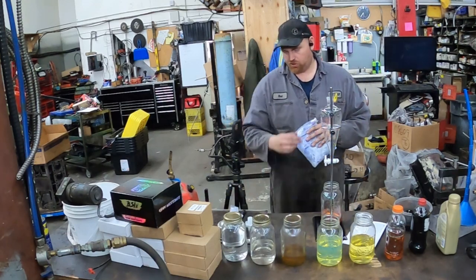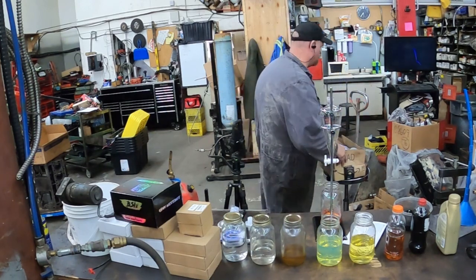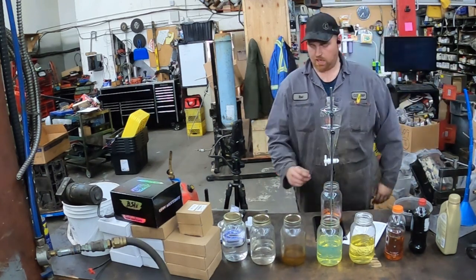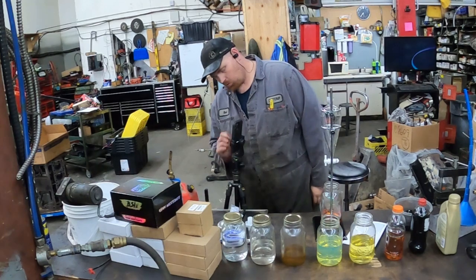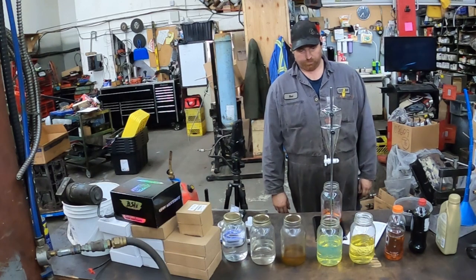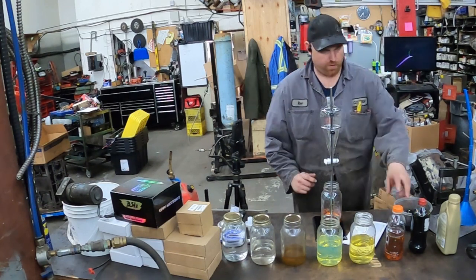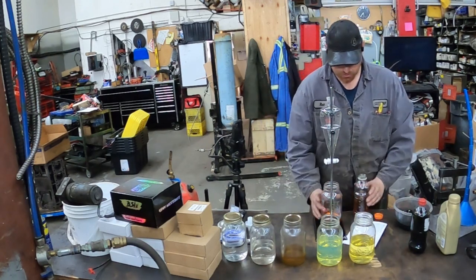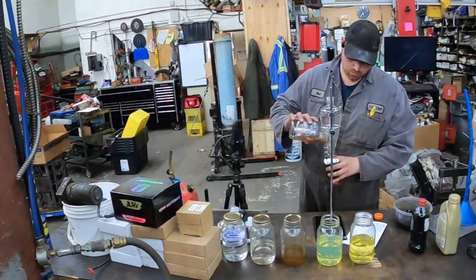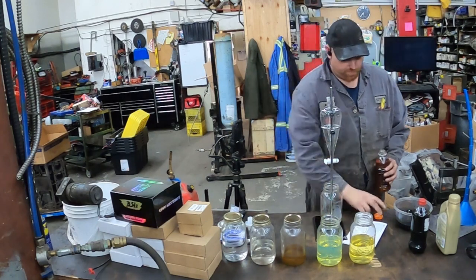I want to do a little bit of mixing so I got a couple of cheap syringes — wow, a whole bunch of cheap syringes actually. Okay, so that's drained out — not bad. We got that one turned off. I'll put that back in here, see if I can't make a mess. Look there — it didn't make a big mess.